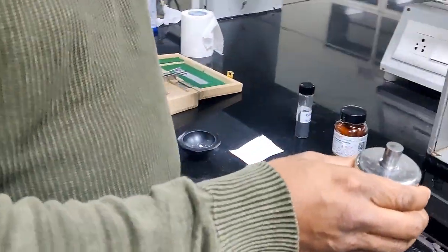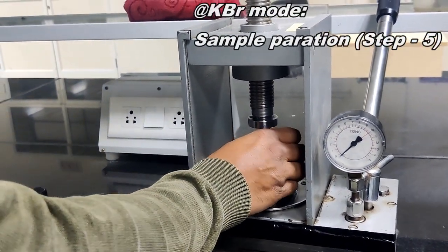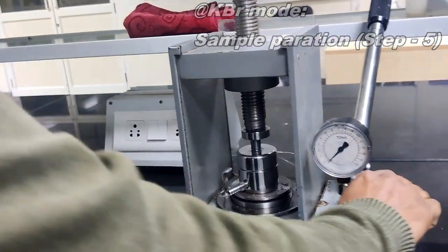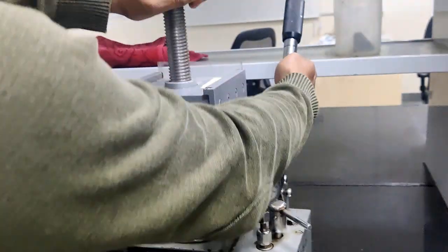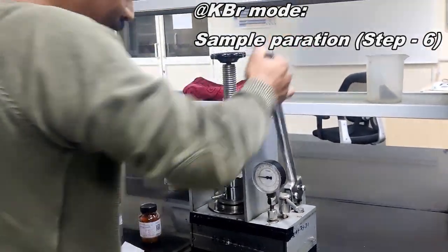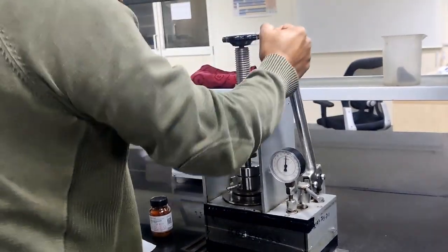This pellet die, I am keeping inside the press to make the sample pellet. I just kept it inside. We need to apply a pressure of 10 tons by using this lever handle. You have to do like this. Then the pressure will be applied when you do it like this.